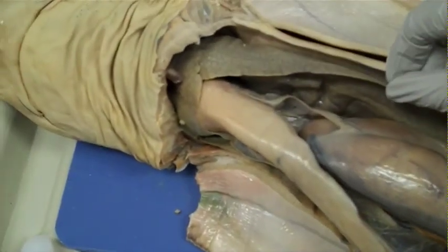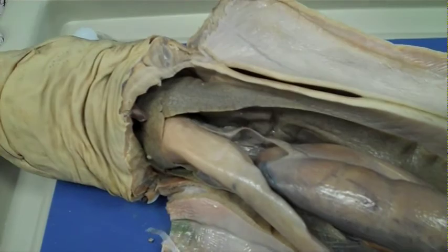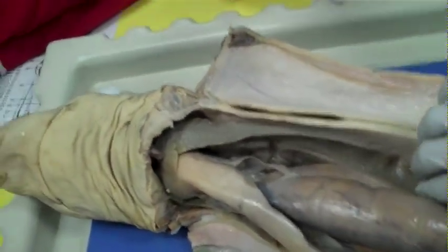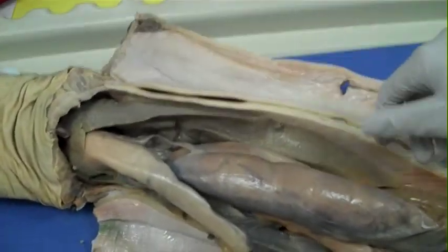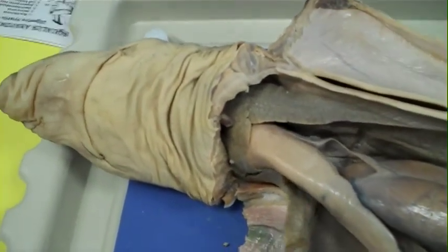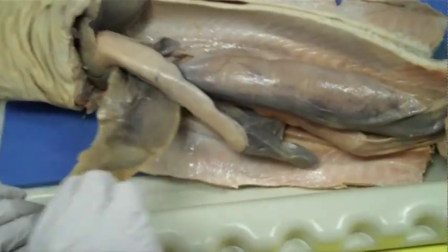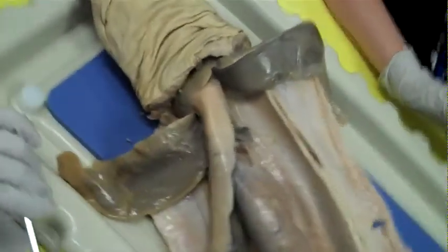Move it so it's on the outside of your shark. You have to pull it off to the side. I can't pick it up — it's too slippery. Just slip your hands in and pull it. There you go. That's the liver. You've got to get it farther out. Big liver — the bigger the shark, the bigger the liver.